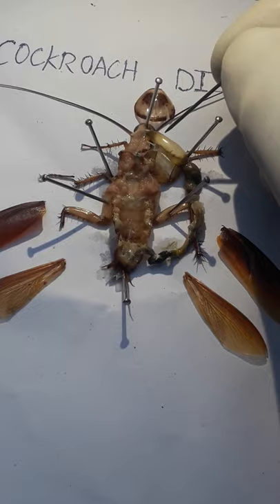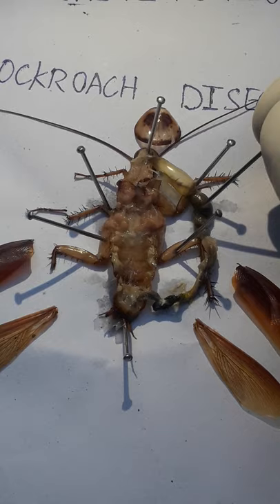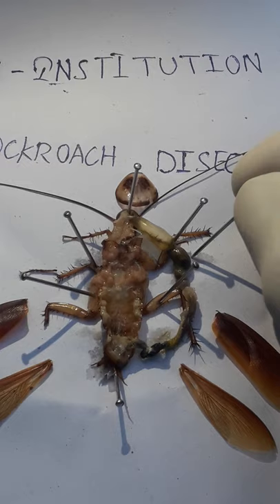Carefully observe: after the oesophagus we successfully reach the crop. Before that, the oesophagus fills with some amount of air, which is why it looks like a balloon-like structure. This is due to air being trapped inside. And this here is the gizzard — I am showing it to you.